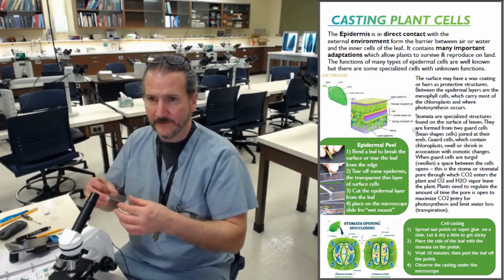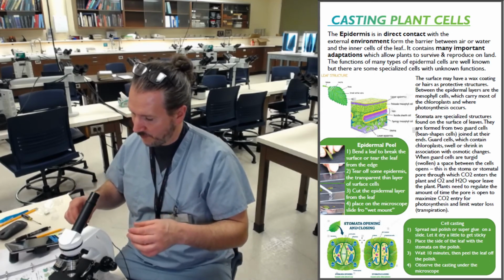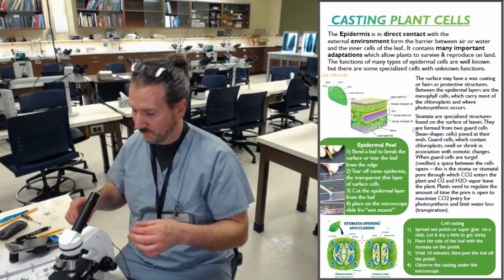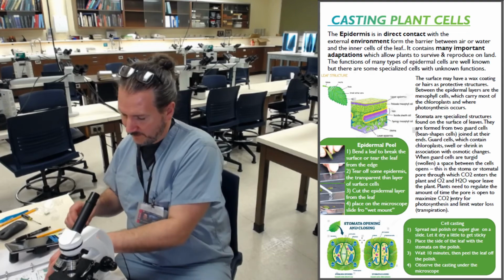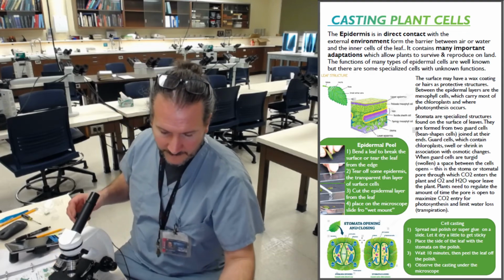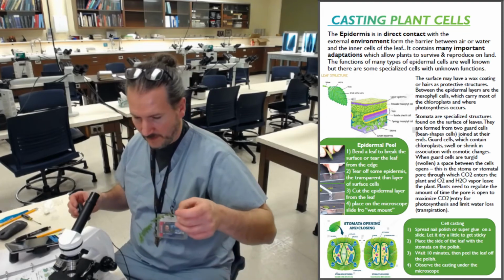We're going to put a little bit of fingernail polish. Don't go crazy. You're going to pick one cell.